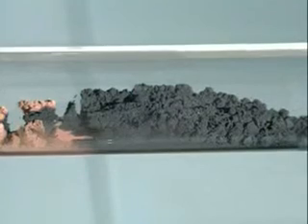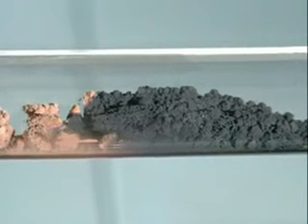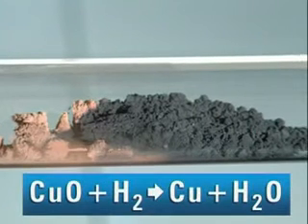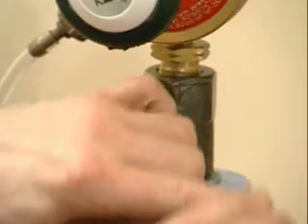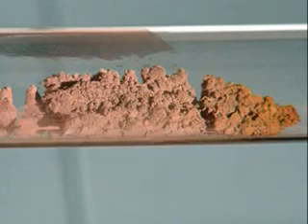Heat the copper oxide in this atmosphere of hydrogen and it quickly changes colour. Hydrogen reacts with oxygen in the copper oxide to form water, and copper metal is left behind. While the copper oxide is reduced, the hydrogen is oxidised. But as soon as the hydrogen and heat are removed, the reaction reverses. What's happening to the copper?